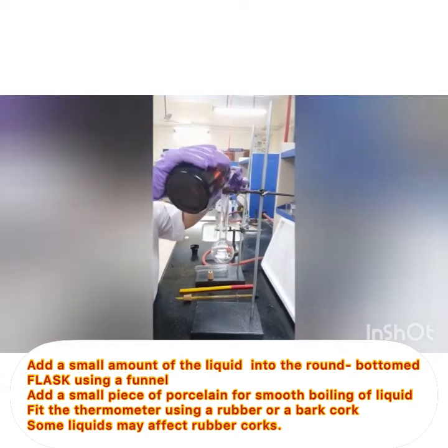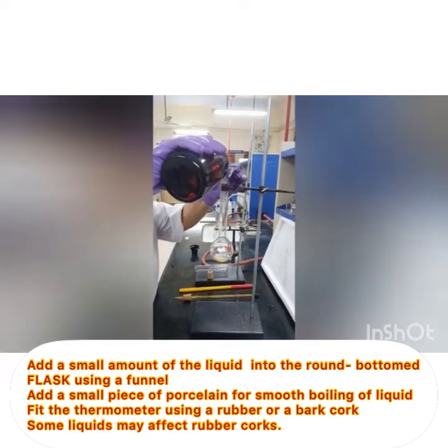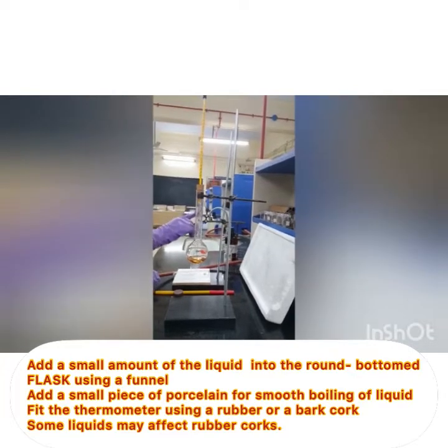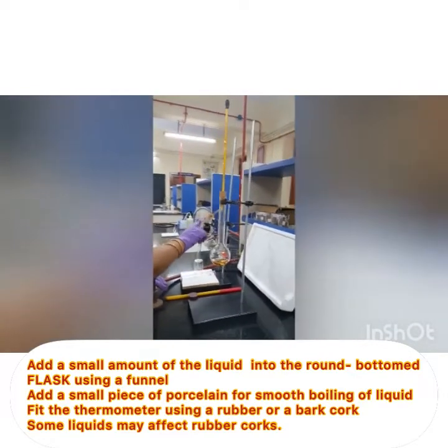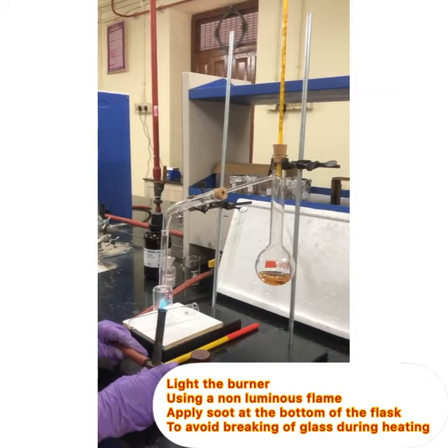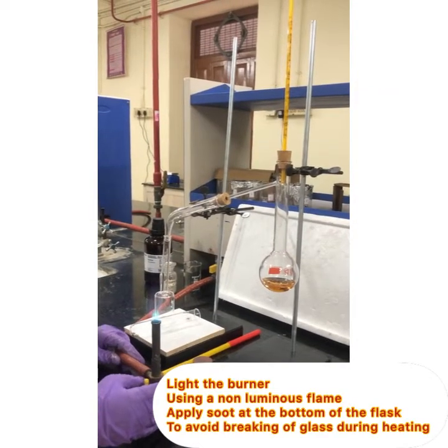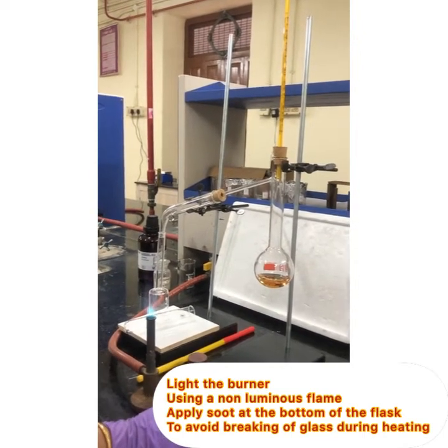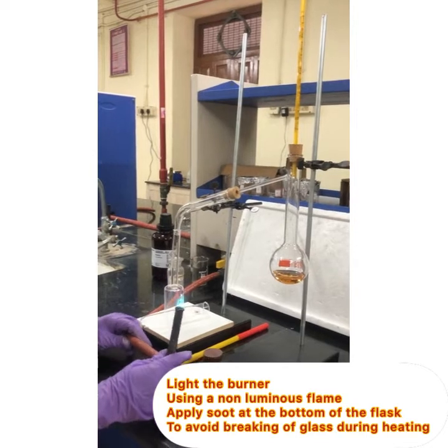Like aniline, using a small funnel. The side tube of the flask is attached to a small receiver tail, which is fitted to a receiving flask or a test tube. Now I will start the distillation. I have taken aniline in this — it is a high-boiling liquid.